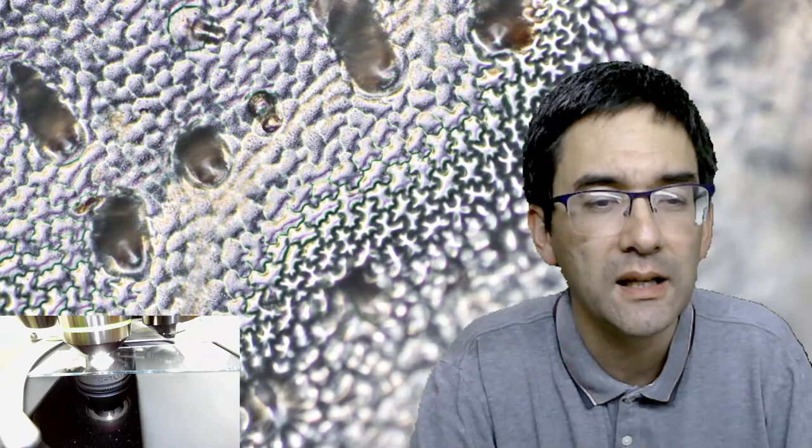Let's put in the other slide. Oh yeah - I think here we see... that's actually surprisingly nice, this actually worked pretty well! Look at this - let's go up with the magnification. Look at those cells - they kind of fit into each other like puzzle pieces. You might be able to calculate the hair density if you know the size of the piece of glue.